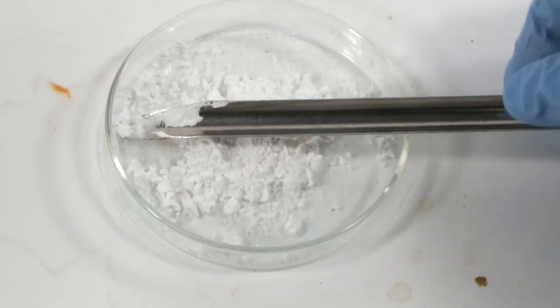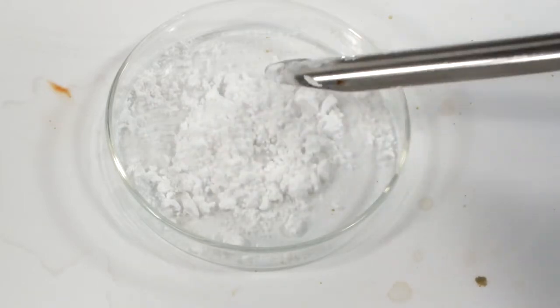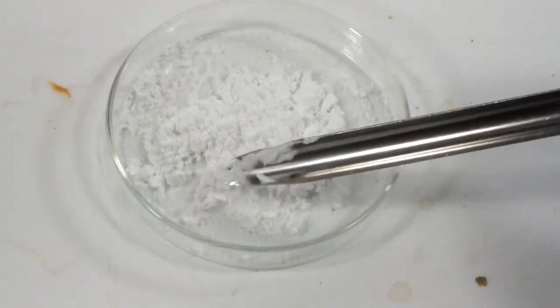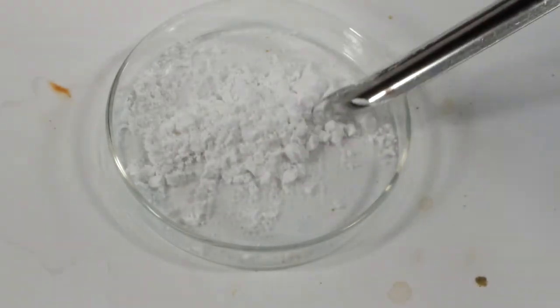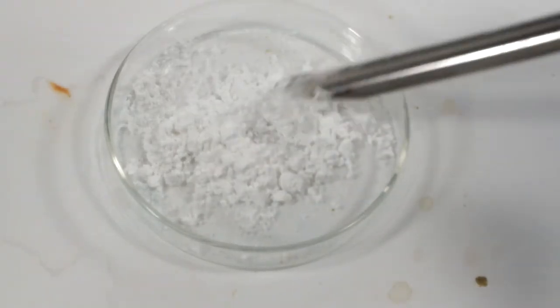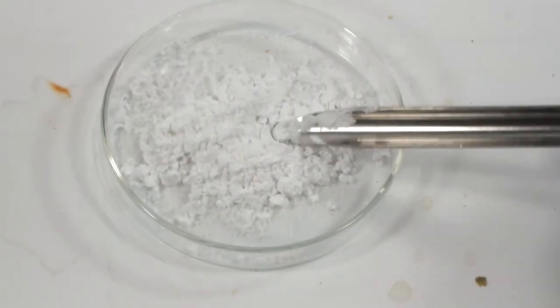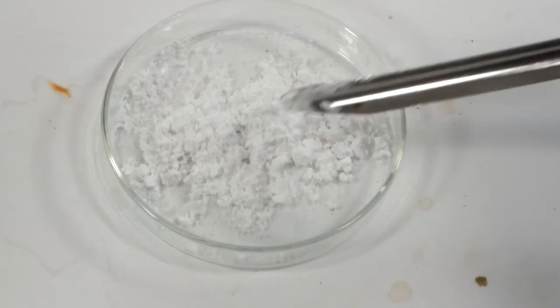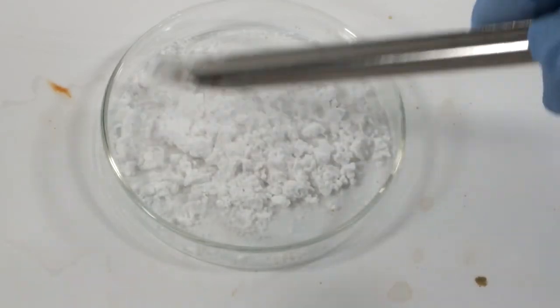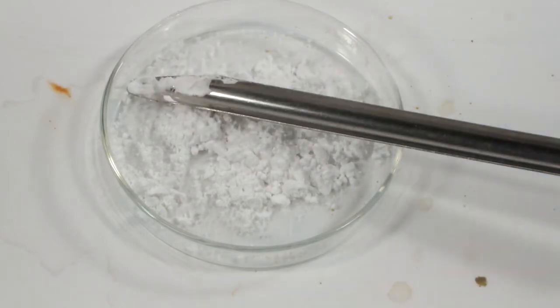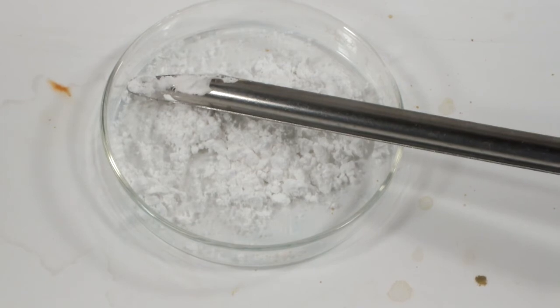This is the dried product. It has a really strange feel. I got a measly 12.05 grams out of an expected 27.8. I don't want to admit the 43% yield, but I will anyway. I can't blame this on the filter paper because it's separated very cleanly. The solubility is a bit higher than I expected at 10.8 grams per liter at room temperature, but at worst that's a gram. I can't confirm that there might be increased solubility in hydrochloric acid solution though. I'm not sure, but I'm not happy with this yield.